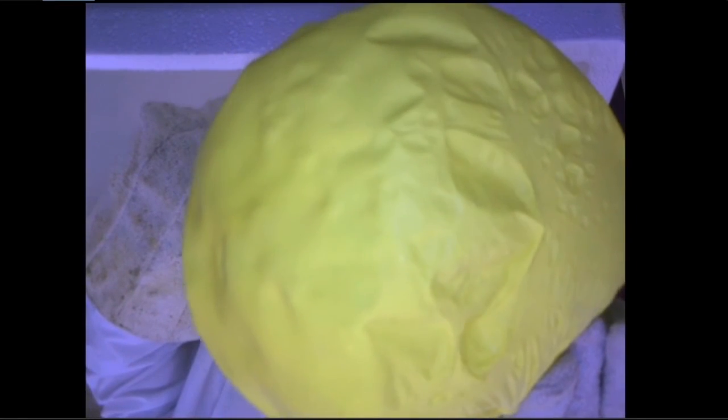So if I let it go, you can see it's like a boat. Put something in it, right? And as I lift it out again, it's kind of crackling. Also, steaming again. And as it comes out, what's changing that's causing this balloon to reinflate?